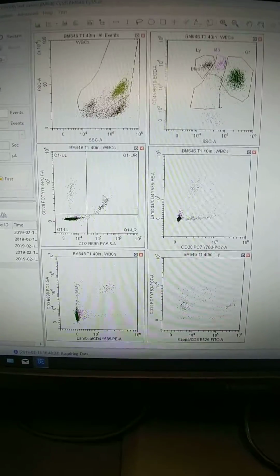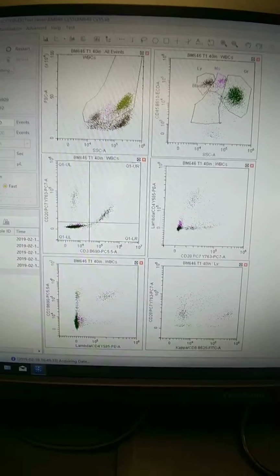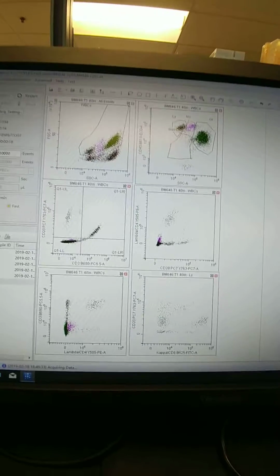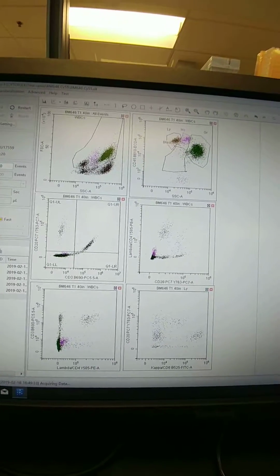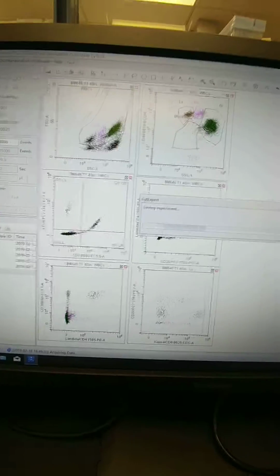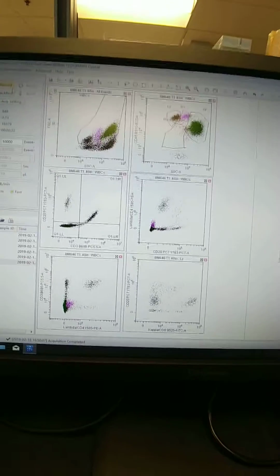What you can see here is you're getting a little bit more diagonal. When you change the gains, it's going to change your compensation values. That's why I'm not worried about trying to adjust everything right now. I'm just letting it run and collect, and then I'm going to analyze it and look later. I'm short on sample too, that's why I'm not adjusting while it runs.